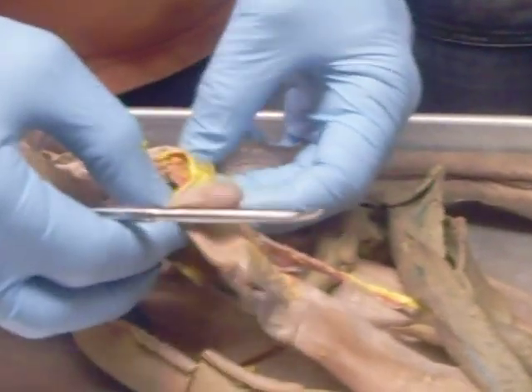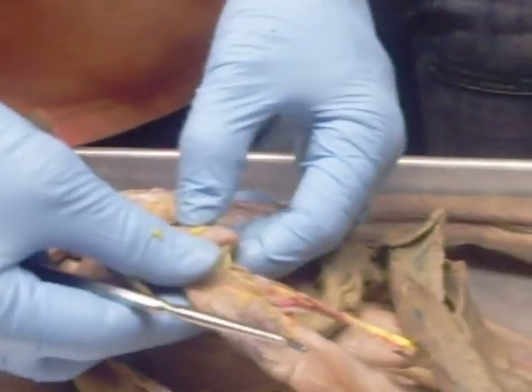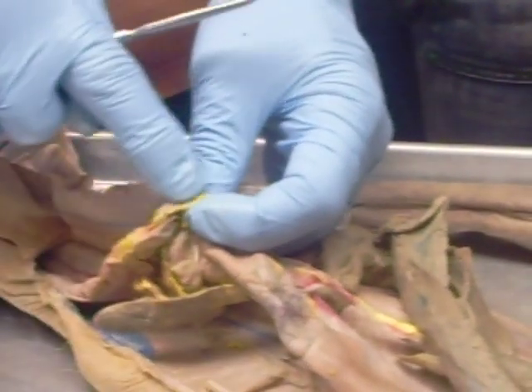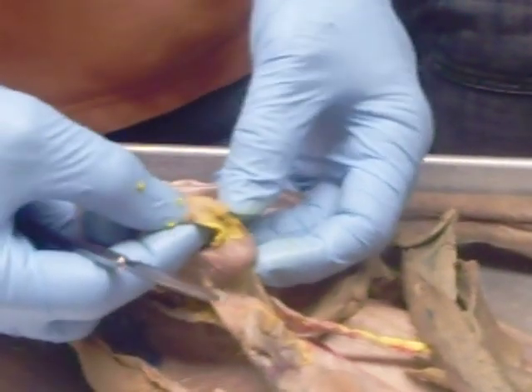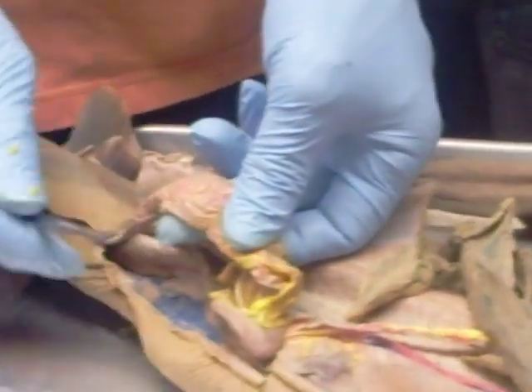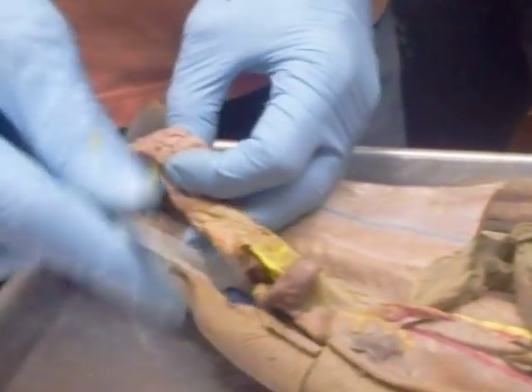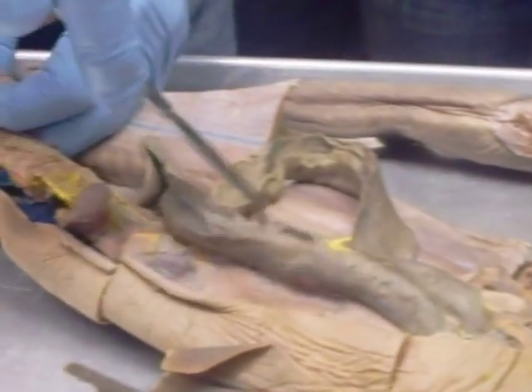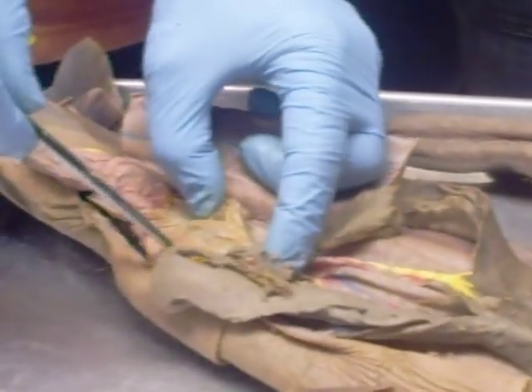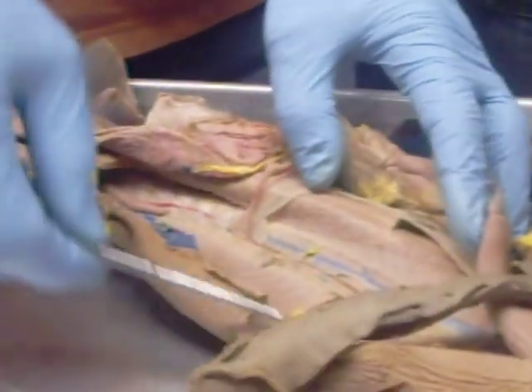Where's the pancreas? I'm not seeing it either. This is the pylorus of the stomach — this has got to be all the pancreatic tissue right here, that tissue off to the side. Usually it's more definitive than that and larger. That makes all of this small intestine. It doesn't have distinct parts really; it has those spiral valves. And then that brings us way back here to the rectum. So: liver, gallbladder, small intestine, pancreas, spleen.